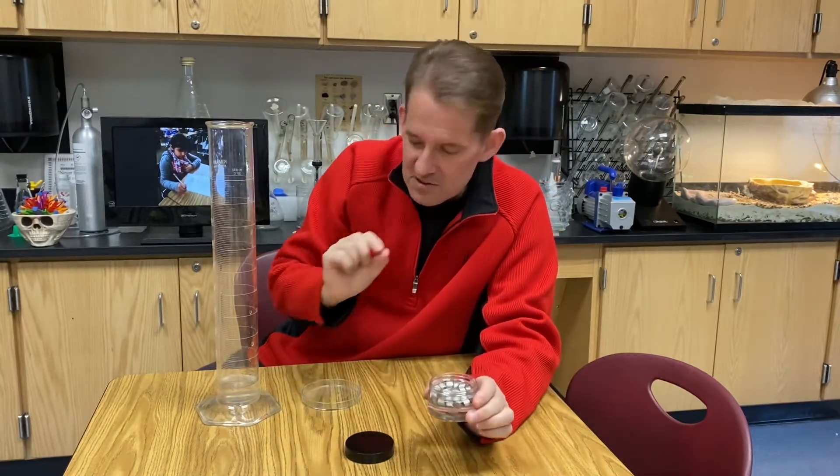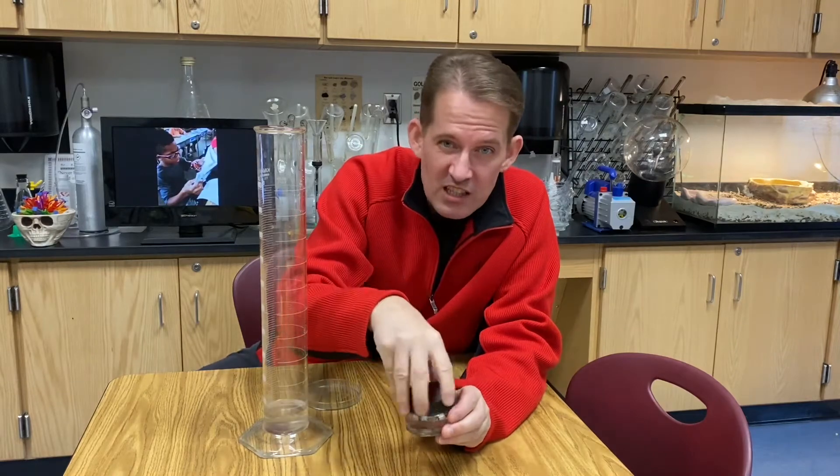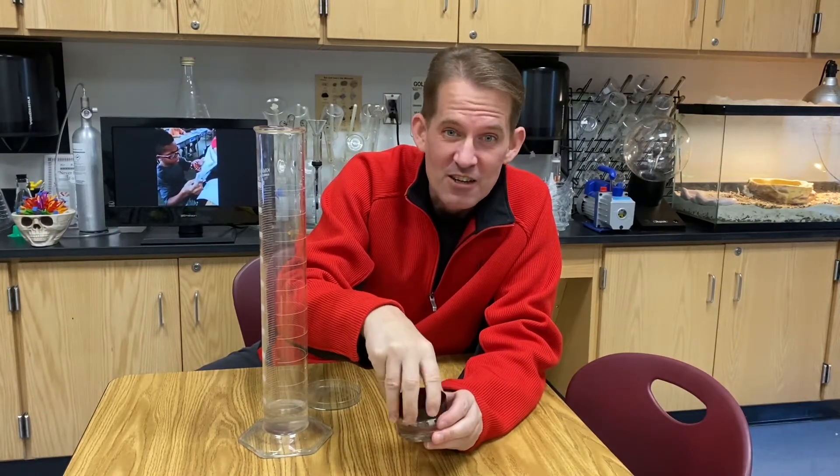And I'm gonna add just a very small amount to my graduated cylinder with some water and it'll change into lithium hydroxide and hydrogen gas. Check it out.